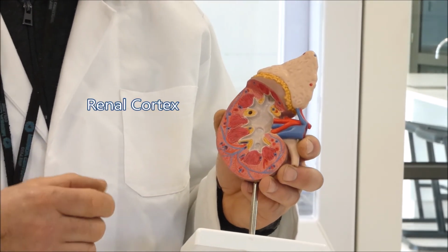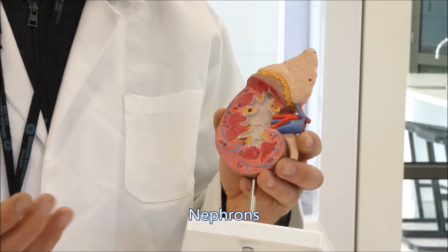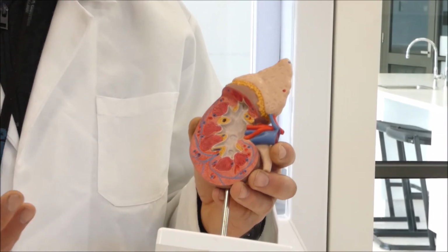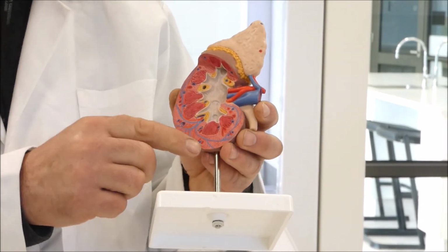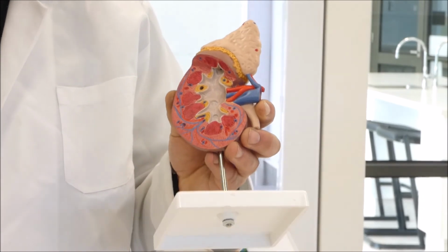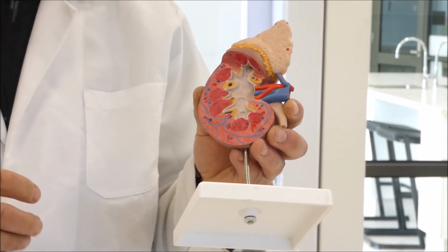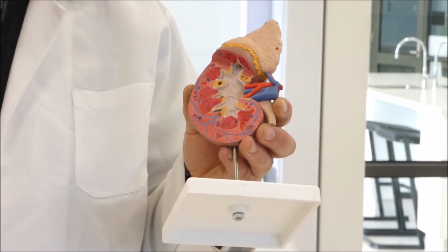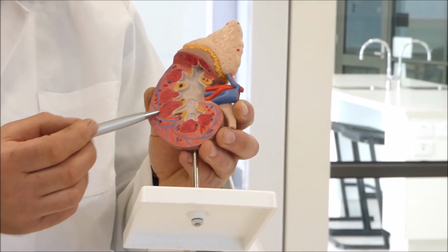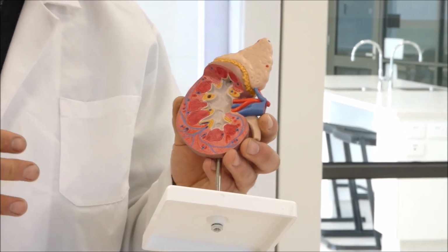Now the renal cortex contains the main part of the microscopic structures called nephrons, which do the filtering of our blood. Now the nephrons have long tubules that go into the renal pyramids, which are those red structures there. If I use a pen it might be easier to see. And that's where all the materials that get filtered out of your blood come from. Those long tubules are surrounded by blood vessels, and those blood vessels bring the blood to those tubules.